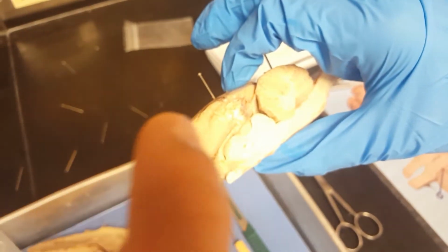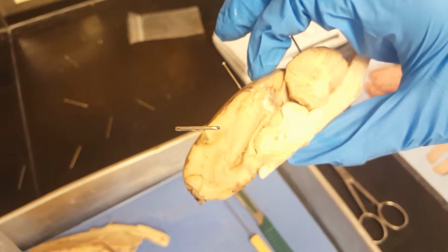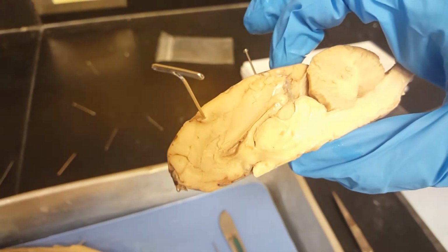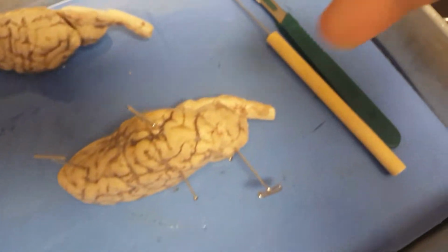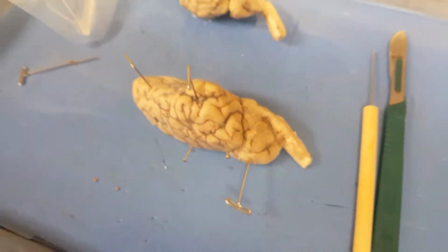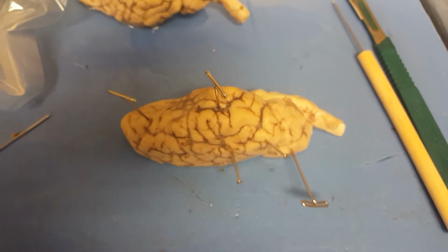So this is the central sulcus. That's a prominent landmark of the brain, separating the parietal lobe from the frontal lobe and the primary motor cortex from the primary somatosensory cortex. The spinal cord, which is not shown but connects right there. That's a cylindrical bundle of nerve fibers and associated tissue that is enclosed in the spine and connects nearly all parts of the body to the brain, with which it forms the central nervous system.